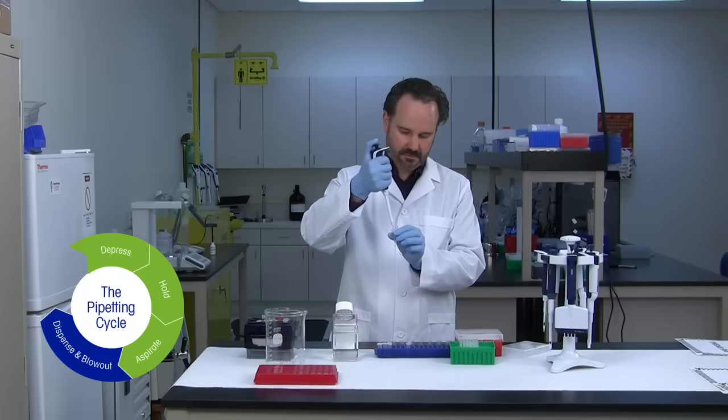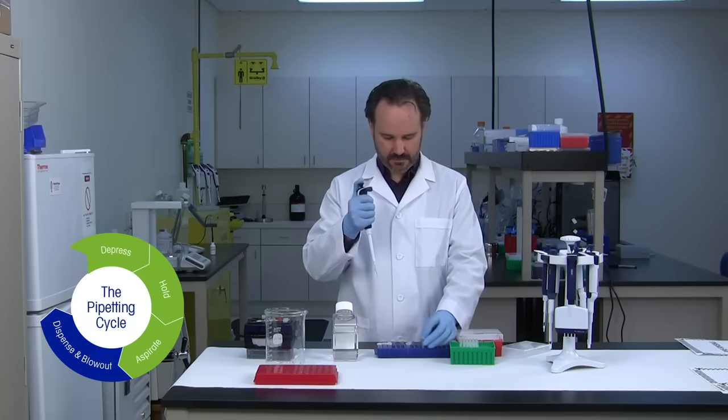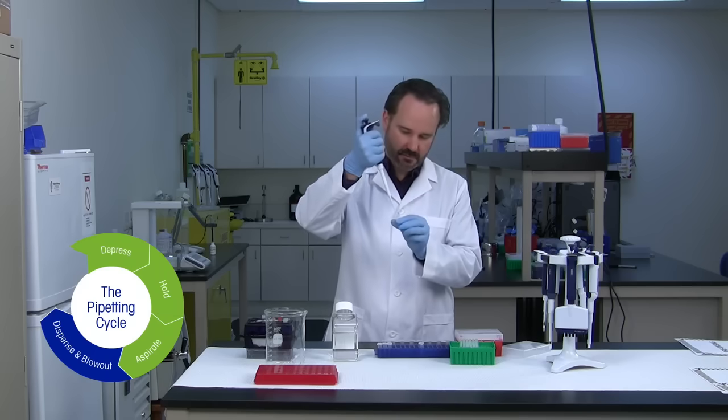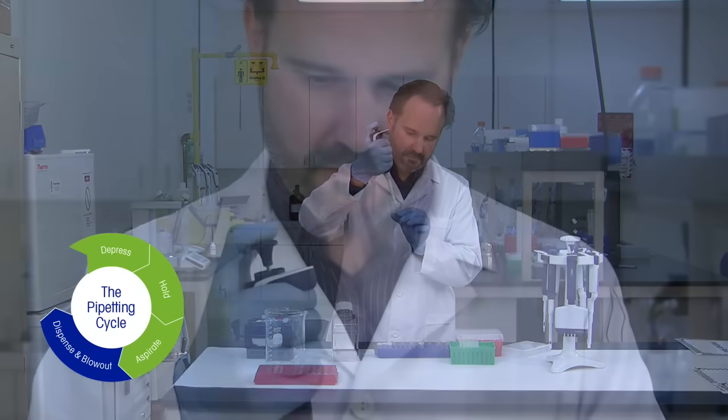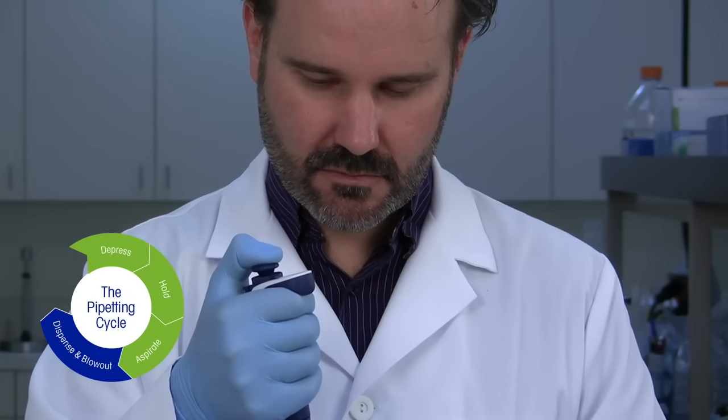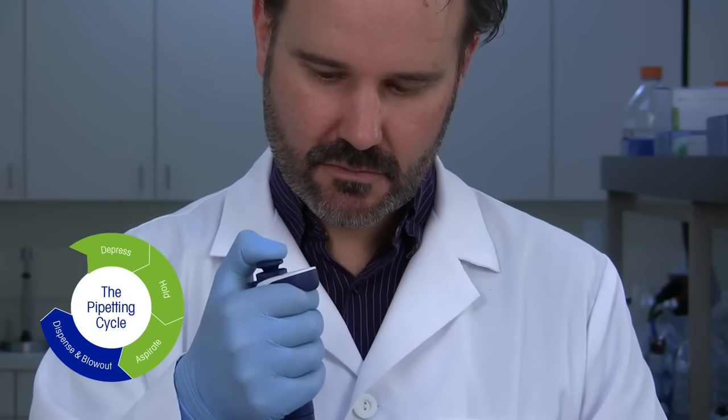Step 3. Dispense the sample into your target vessel by pressing down on the plunger in a smooth continuous motion until it reaches the first stop. Pause here momentarily.